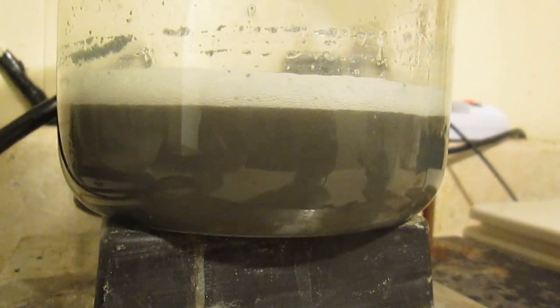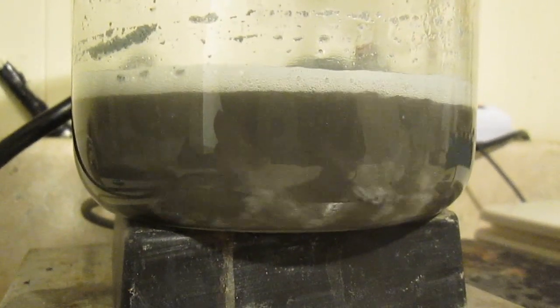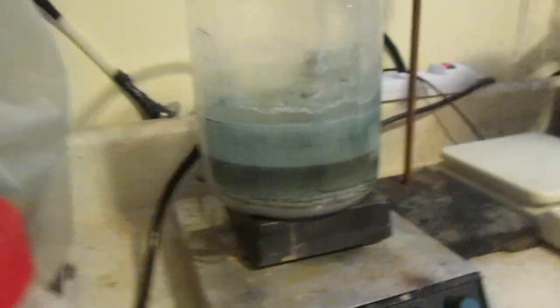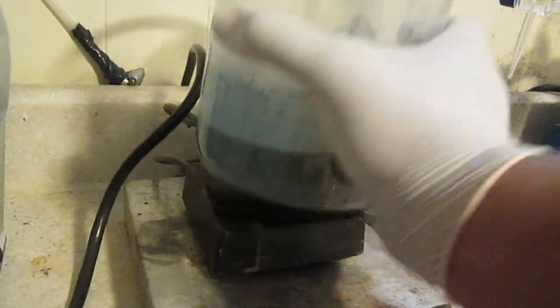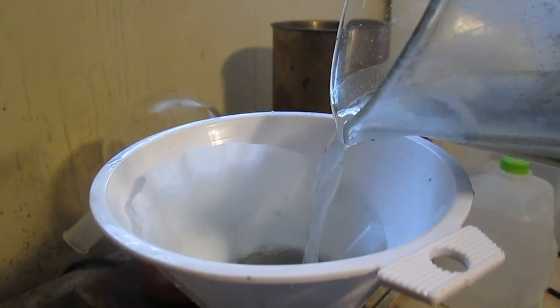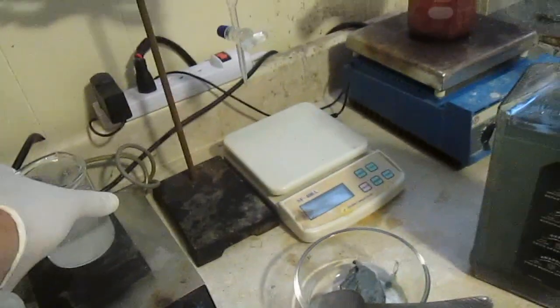That's why I use a big beaker — if you add too much it will foam up a lot after a while. The mercury is starting to precipitate and immediately bonding with the aluminum to form an alloy. It shouldn't take too long now. We should start seeing mercury — it's probably best to do this outside or under a fume hood. Once it has settled, all that's left is to filter this alloy. There it is right there — a tiny little bit of mercury.